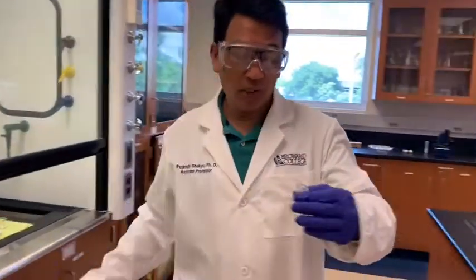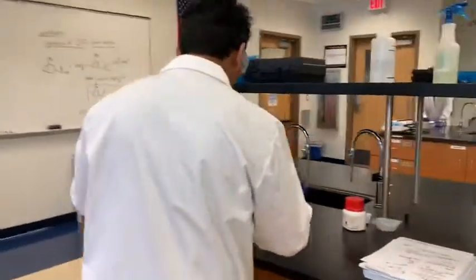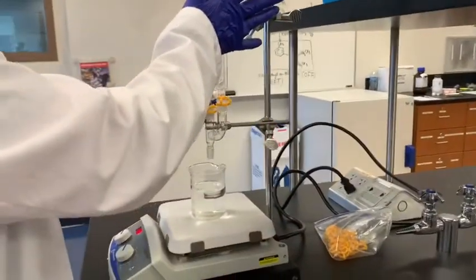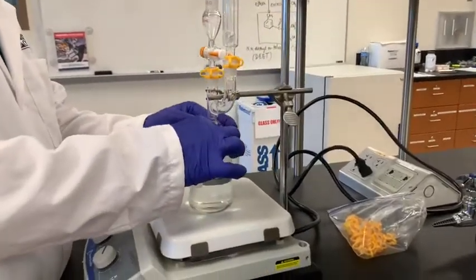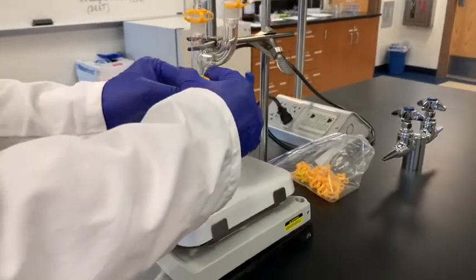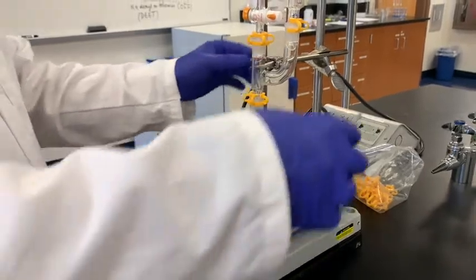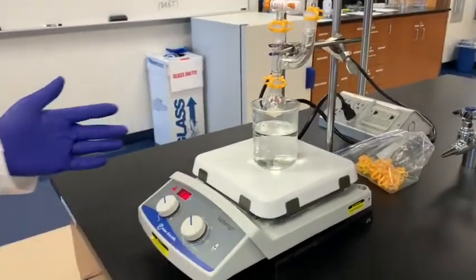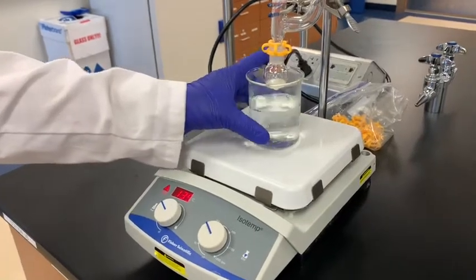All right, so now this needs to be heated. The apparatus setup is here, that is what I have shown here. I will put this here in the condenser, the Claisen condenser. I will clamp it here, and that needs to be heated to a temperature of about 90 degrees Celsius. So I use the water bath. This water is already preheated there. I need a temperature of around 90 degrees.